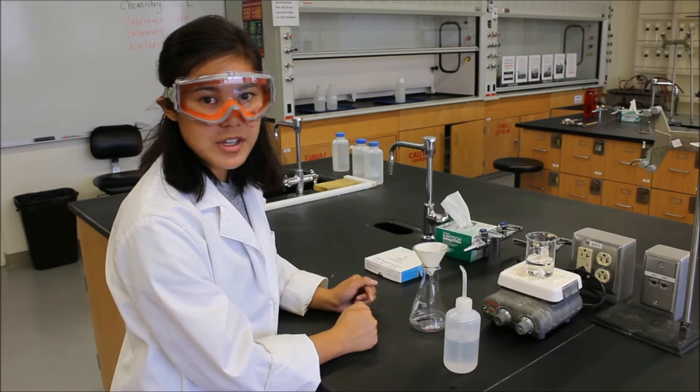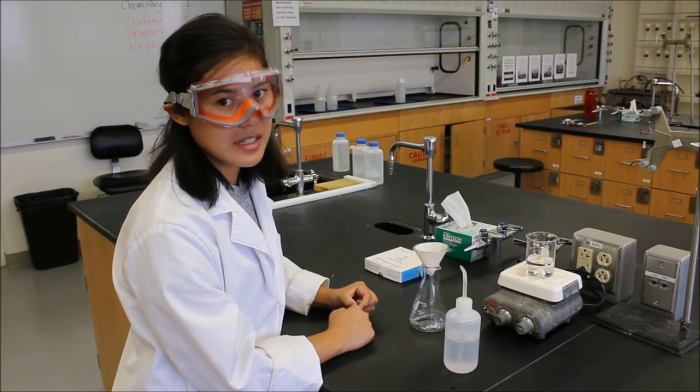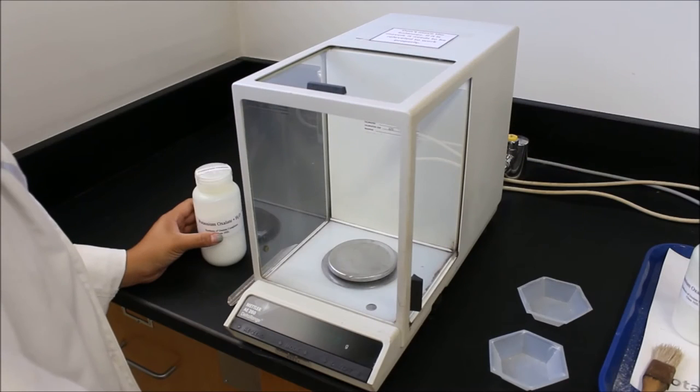Next, we're going to go and move over to the balances. And I'll remind you how to use the balances and how to clean them up. This is your analytical balance. You've seen these already before in the 101 labs.